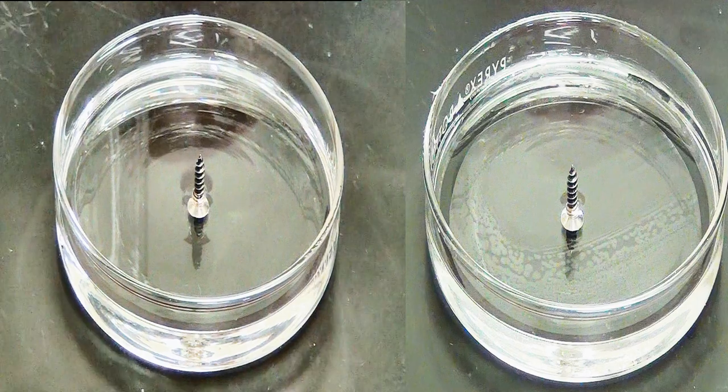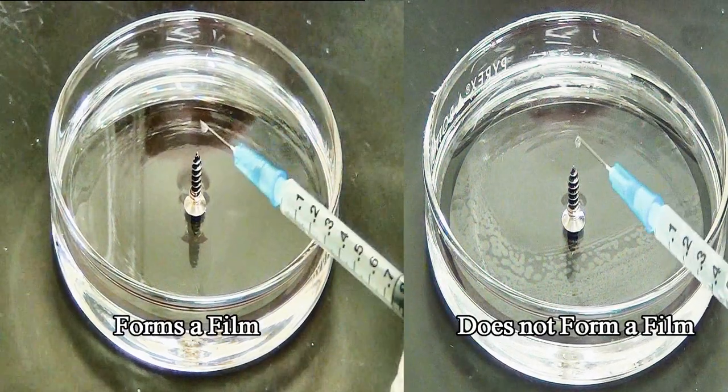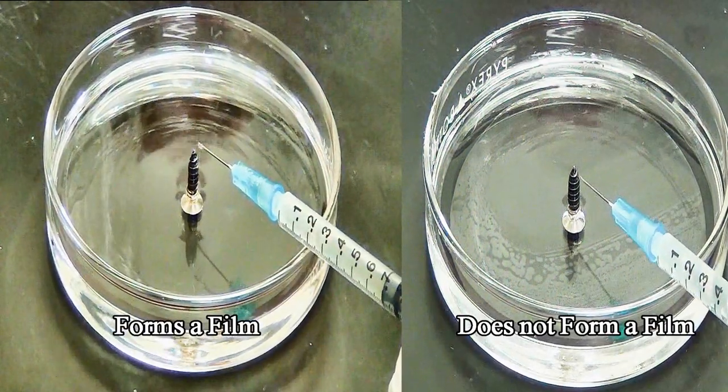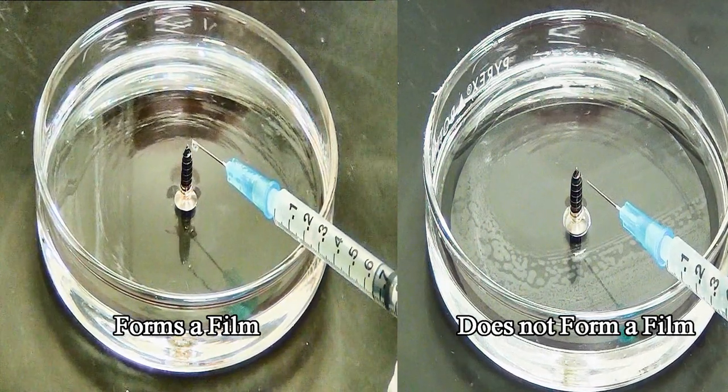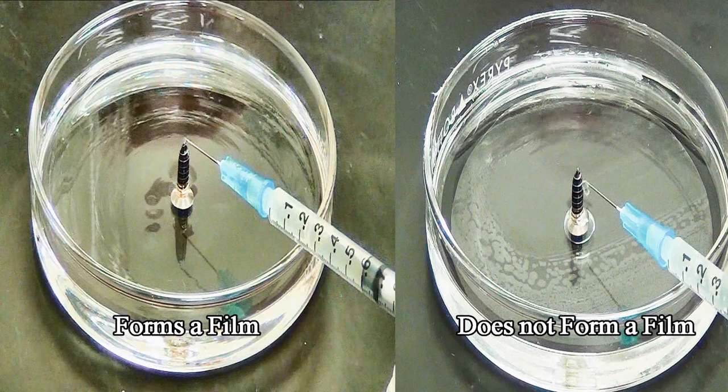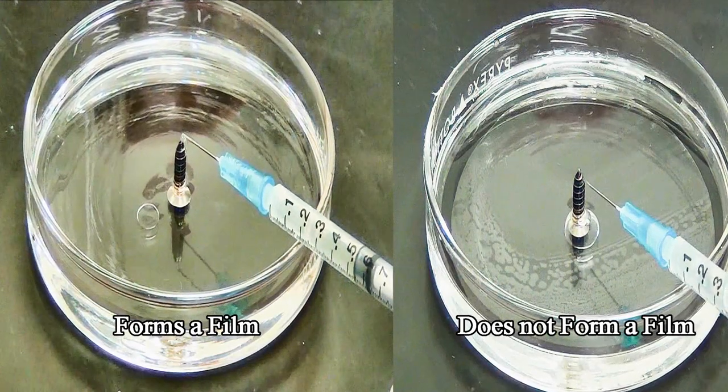Here at Dyne Technologies, we need to ensure that any film-forming foam forms a film. An example of a way to test this is to actually place the solution onto a fuel. The amount of fluorochemical in the foam solution directly affects the foam's ability to form a film by lowering the surface tension of the solution.